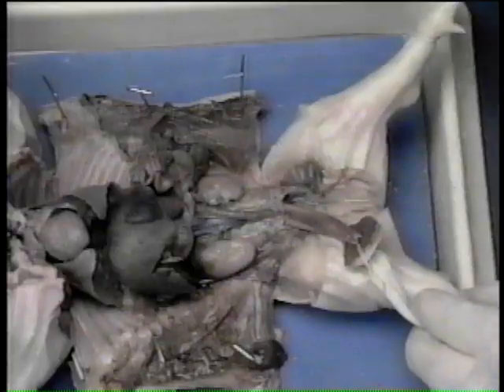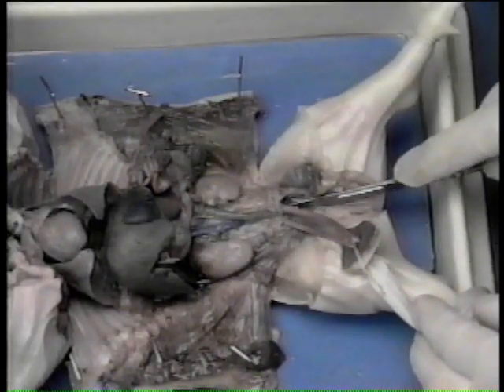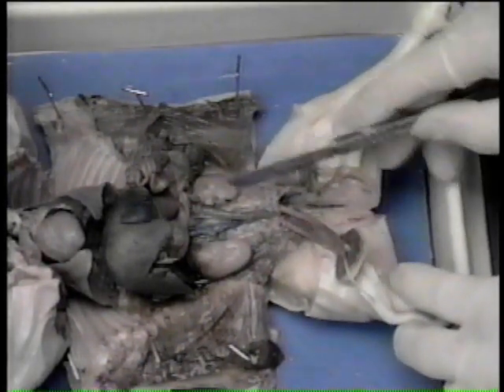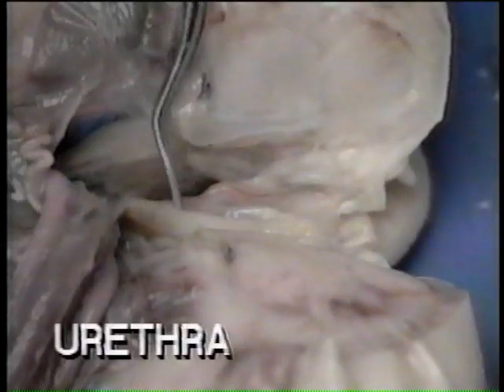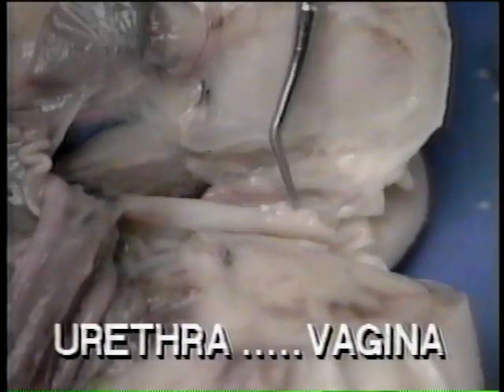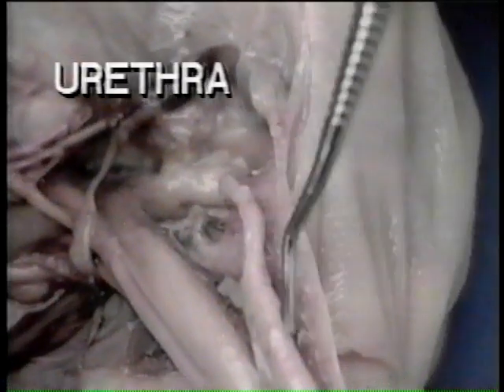Expose the urethra by cutting carefully through the cartilage between the hind limbs. Now, follow the urethra to its union with the vagina in the female. If the specimen is a male, follow the urethra to its continuation with the penis.